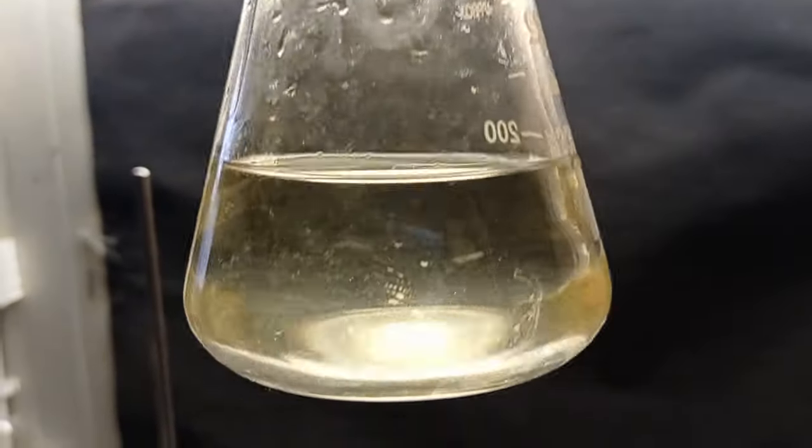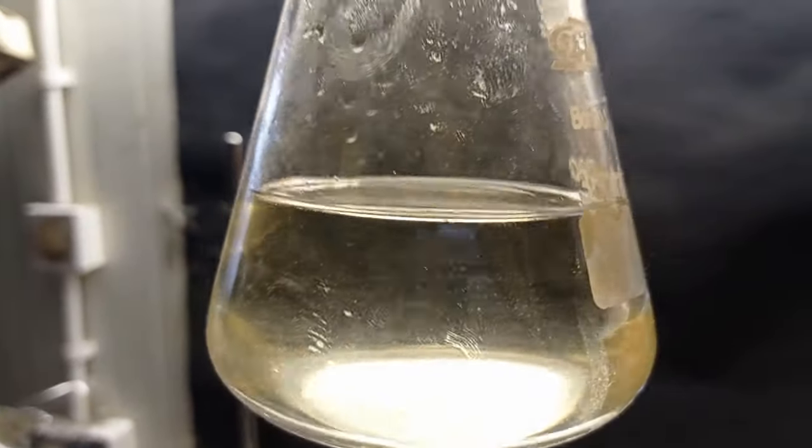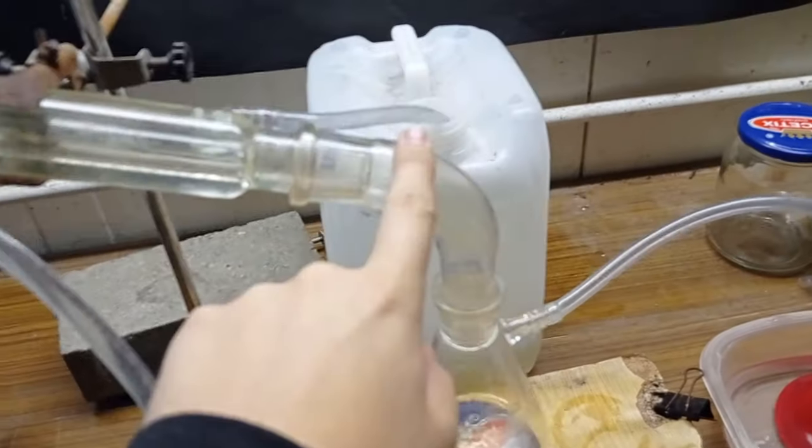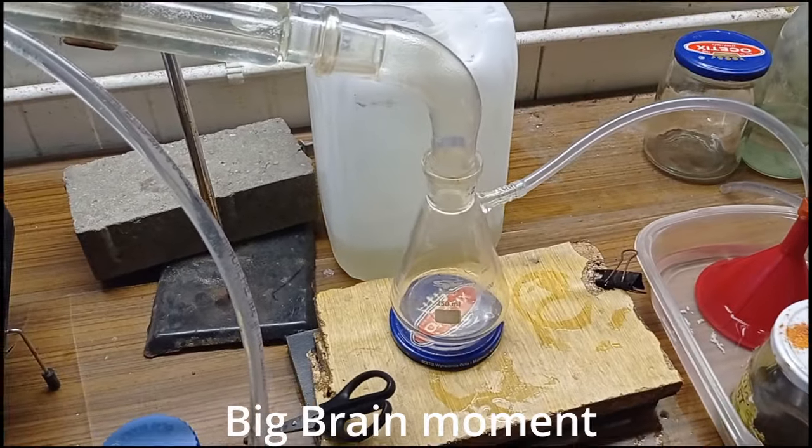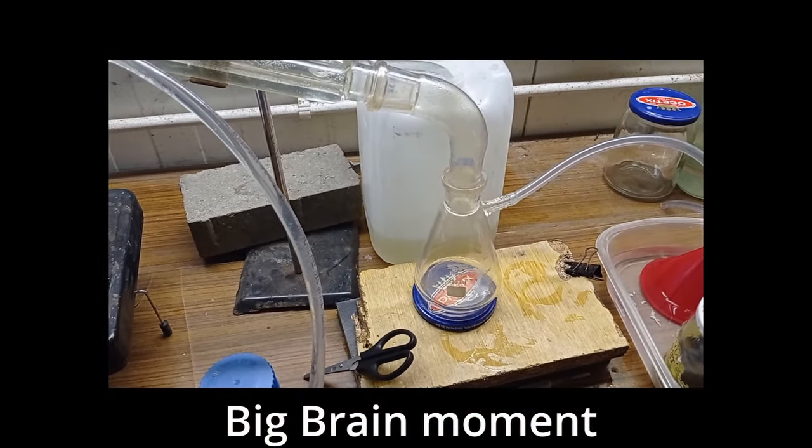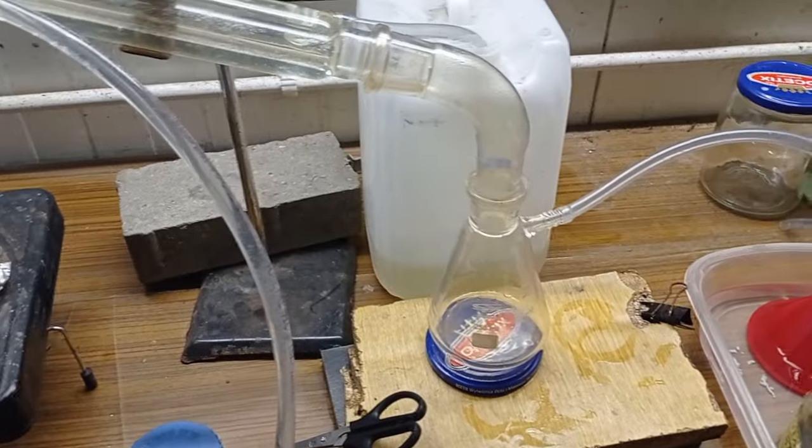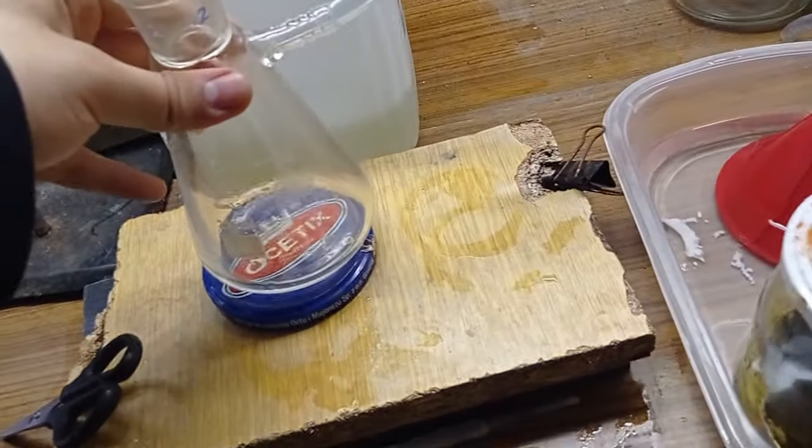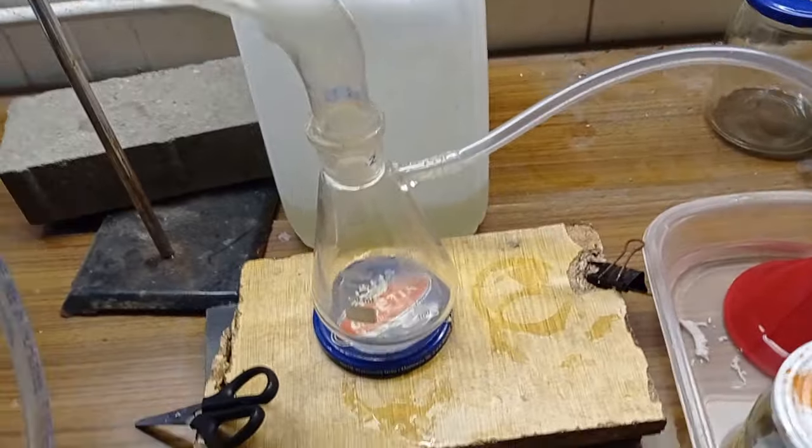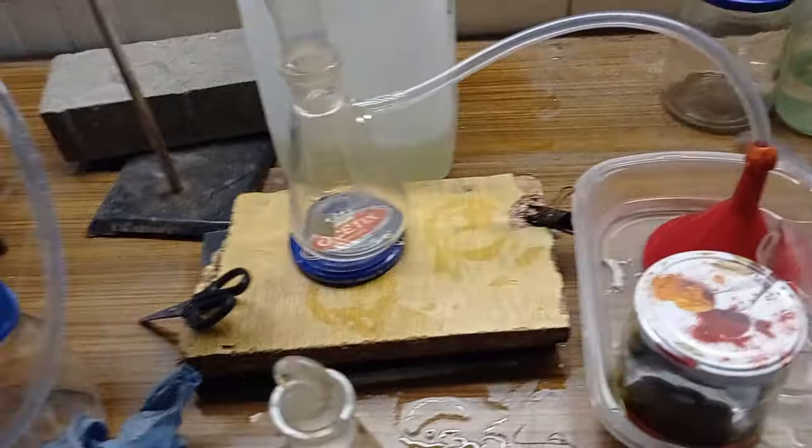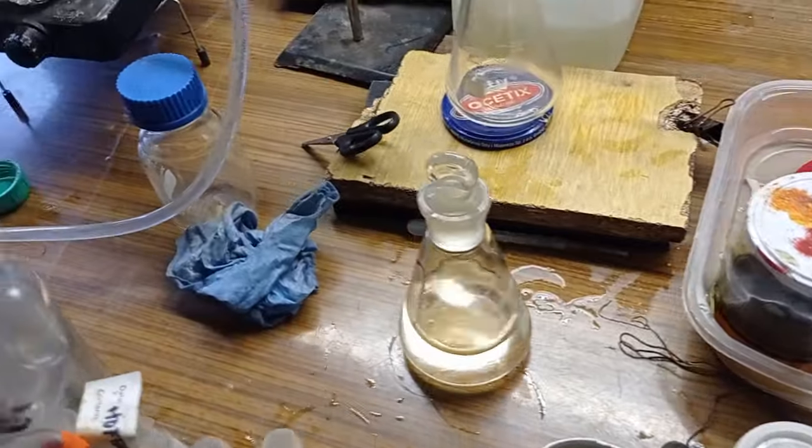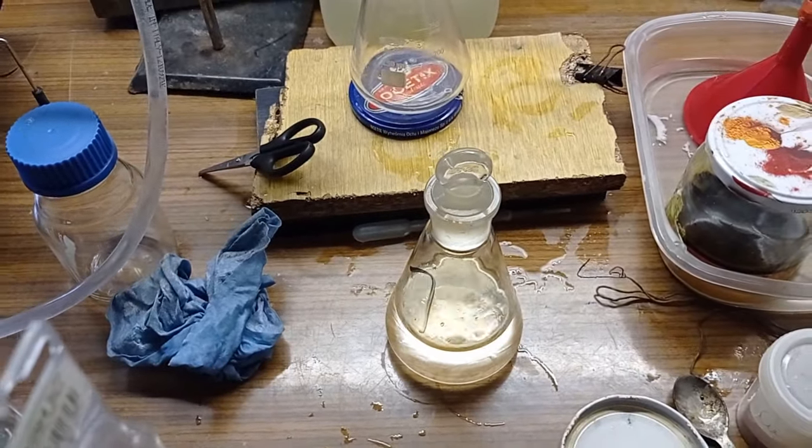Here I got the first amount, the first phase, and I saw that drops dripping down to that solution have different density. So I decided to quickly switch the container for a new one so I might get even more concentrated nitric acid. That's pretty strong nitric acid. I wonder if this is enough to perform nitration.